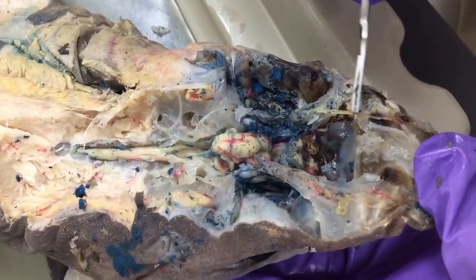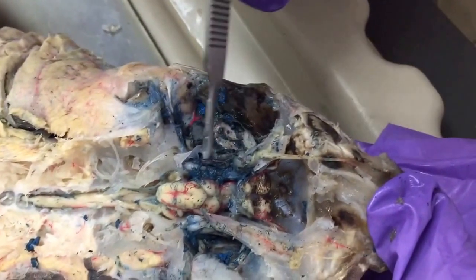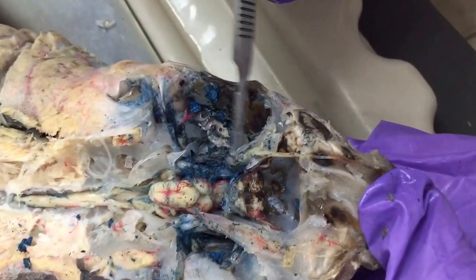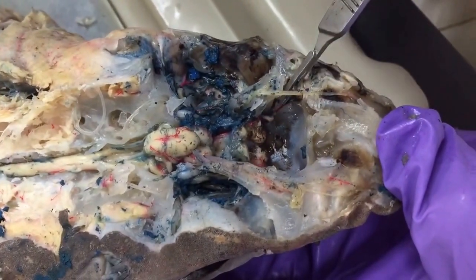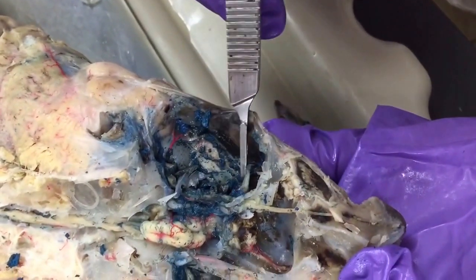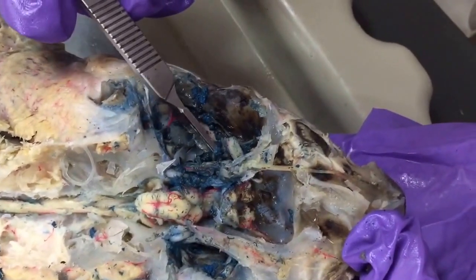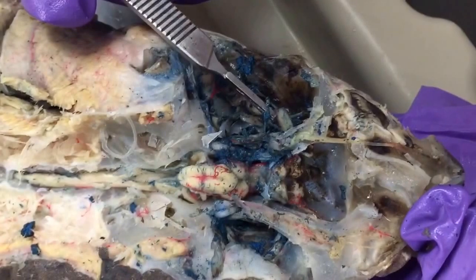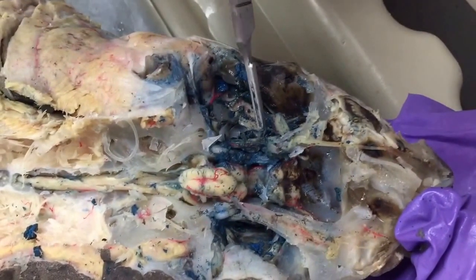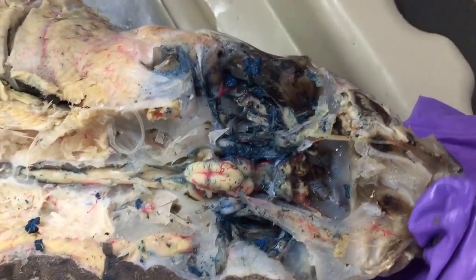Okay, so we had our superficial ophthalmic trunk here, remember, and our infraorbital trunk here within the orbit. Both of those contain cranial nerves 5 and 7. The olfactory nerve here within the olfactory tract. And then if you're looking actually in the eye itself, you can see the trochlear nerve is this little guy here. It innervates a couple of the muscles of the eye. It's smaller and runs perpendicular to the infraorbital trunk here.